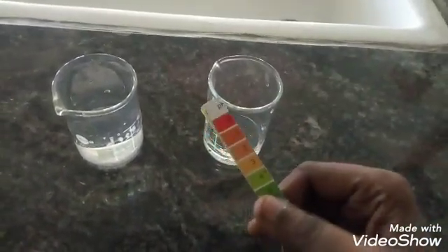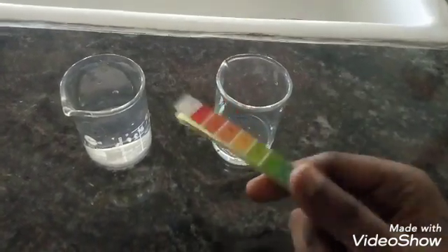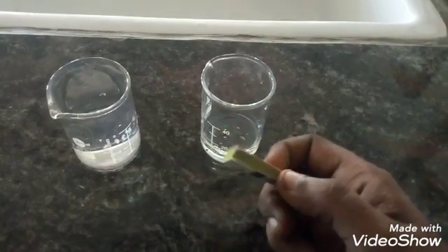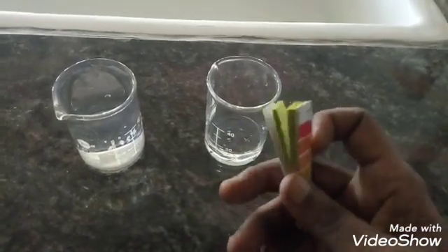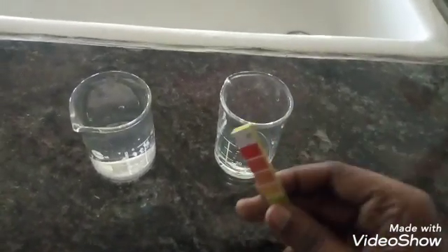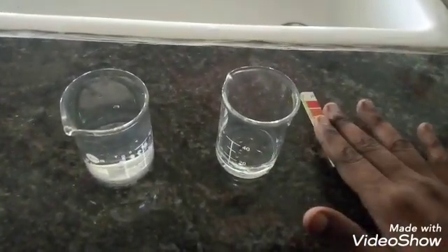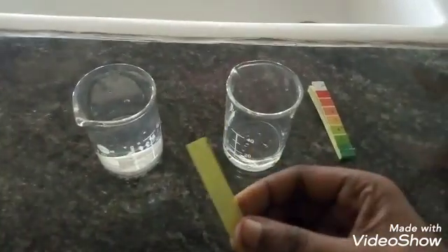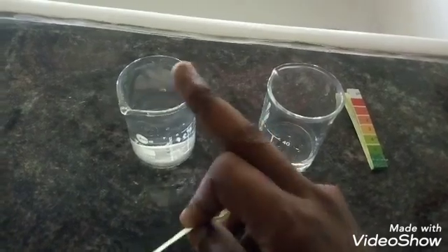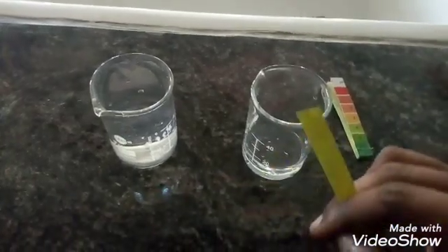This is the basic part of the paper. Now I have a paper. I am using this one. This is a water. It is not acidic.